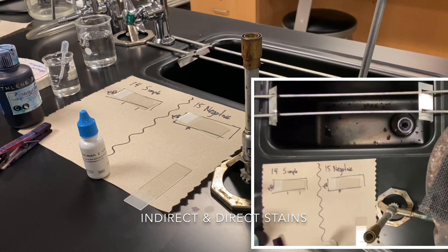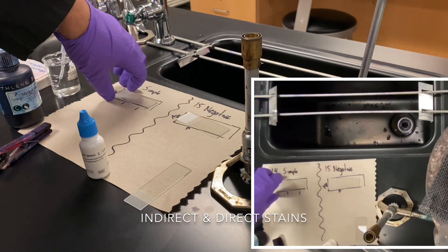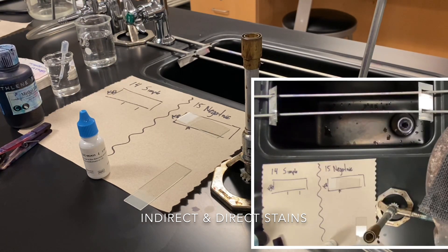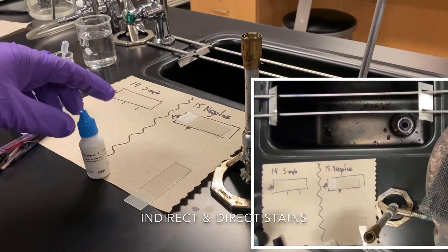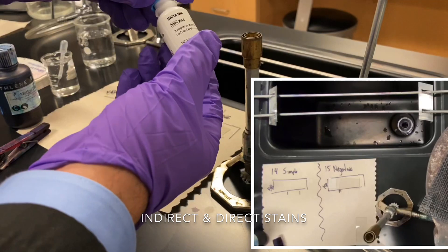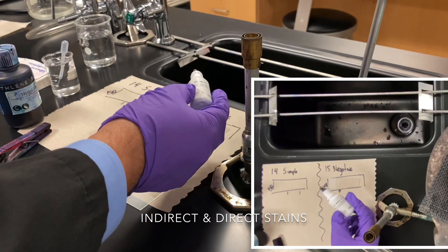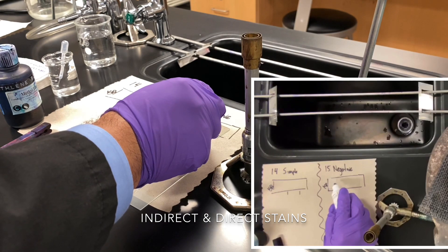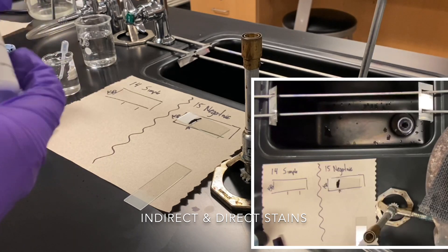What's unique here is that the simple stain needs to air dry, so we can wait or place it on top of the rack where the wires are. The negative stain, on the other hand, needs to air dry with its stain. So while the simple stain is drying, we'll take our India ink and add one drop — this pours very fast so be careful — just one quick drop, then close it and clean up any spills.